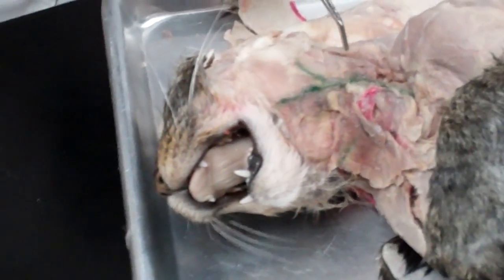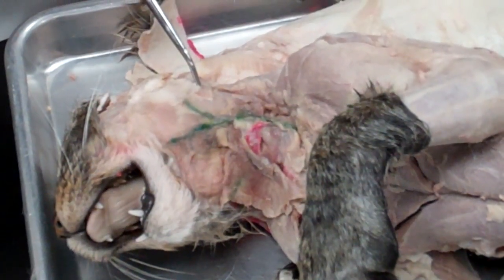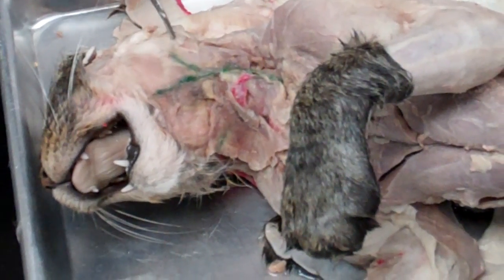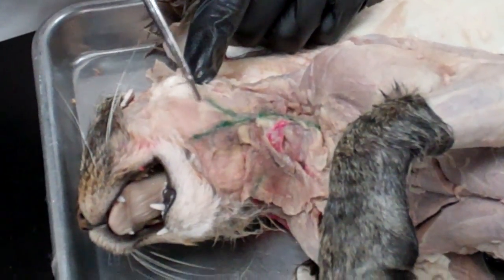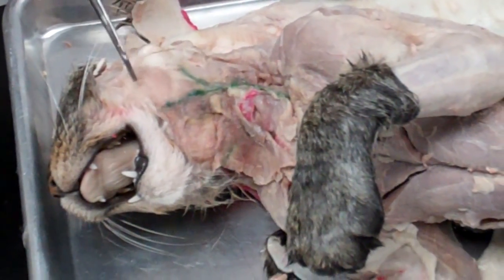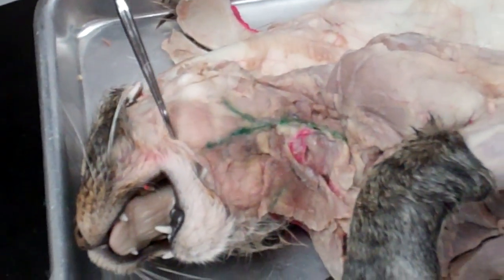Then you have the posterior facial vein, which goes to this white area around the ear — that is the parotid gland. This pinkish structure here is the masseter muscle, and all you need to do is identify the masseter muscle right here.